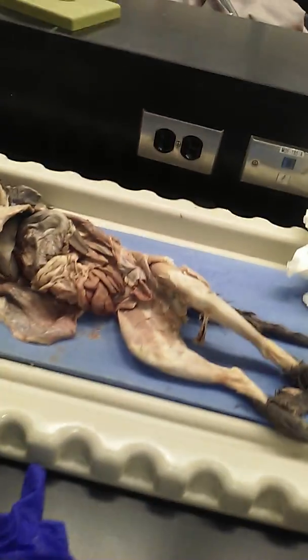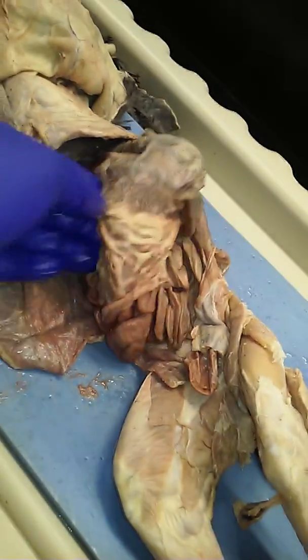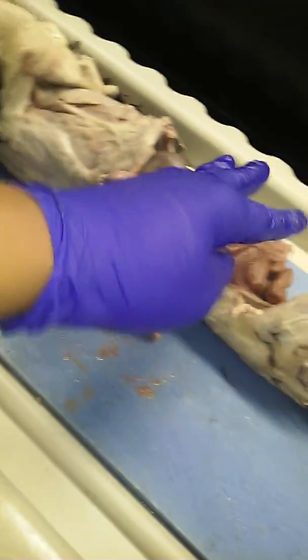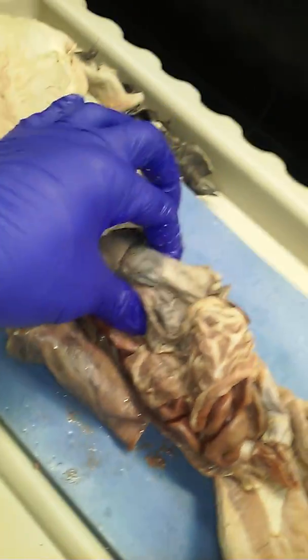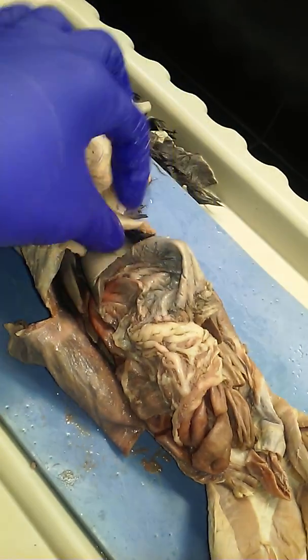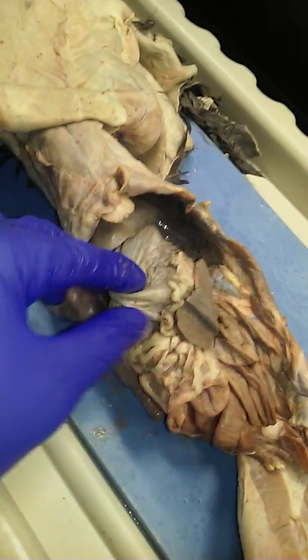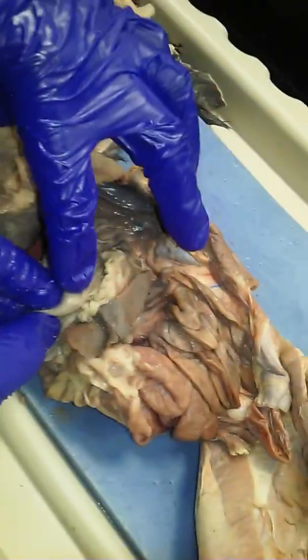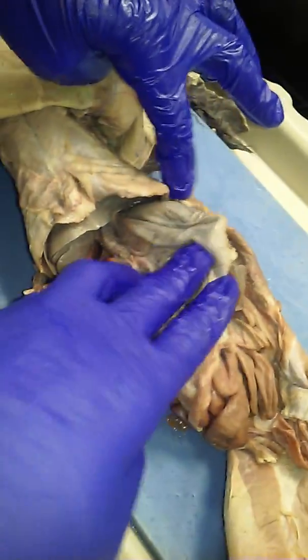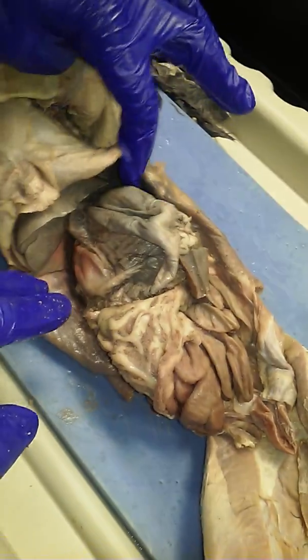It's shaped like this. He's not on his back. Sometimes it's kind of hard to see at first, but it's sort of shaped like this. On your list, you can see that I'd like you to identify several parts to the stomach. So is that the U shape? What we should do, easier here, is for us to start with the human. Look up here, please.